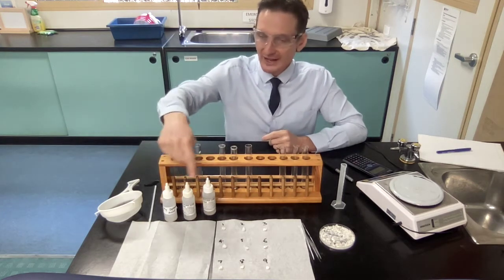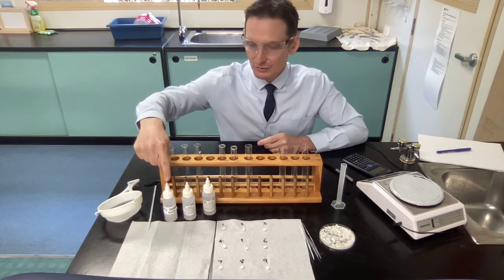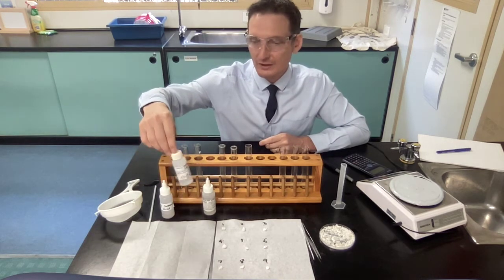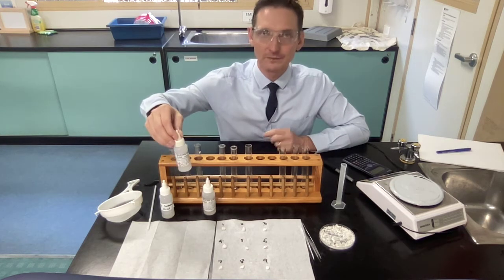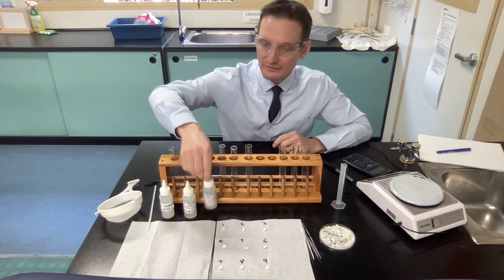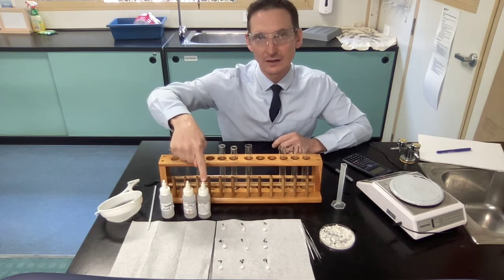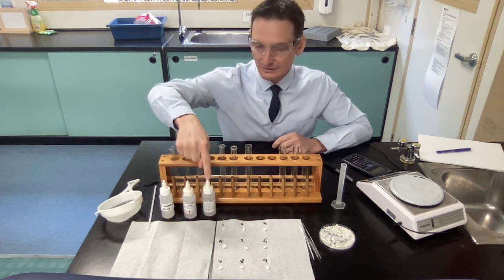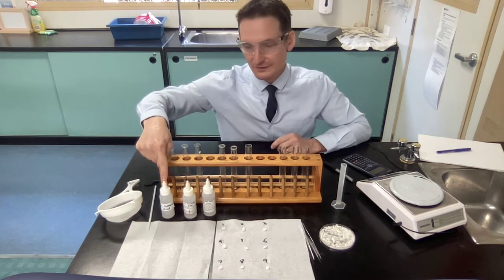rain. And we've got 3 acid rains today. One that you're going to make up, an acid rain called carbonic acid, and I'll show you how to make that. And then we've got a considerably concentrated type of acid rain, which is 0.5 molar sulfuric acid, and then we've got 1 molar sulfuric acid. So this one here is twice as concentrated in terms of molarity compared to this one. This will be quite weak because we're going to make it ourselves, and I'll show you how to do that in a second.